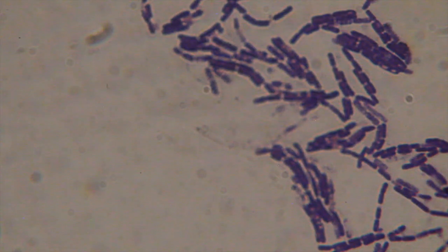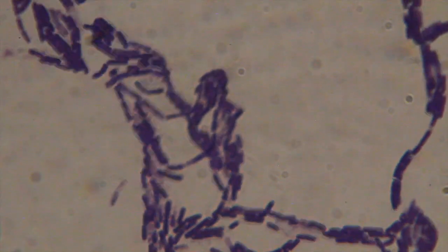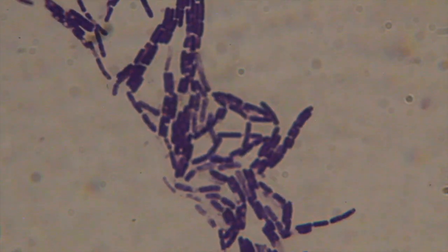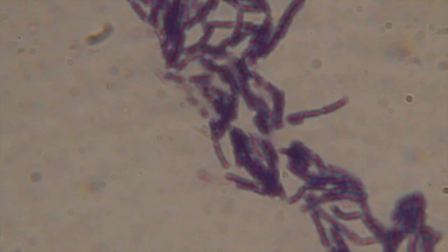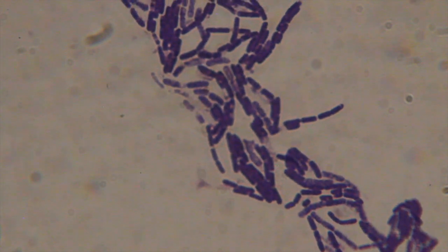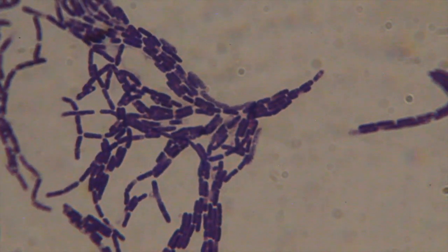These bacteria are all pretty much the same. So basically we have long chains of rod-shaped bacteria. There we can clearly see 2 individual in a chain. These are all the same species. They come from a single colony, and they're all exactly pretty much identical. Long rods on there. So big long rods that occur in chains.